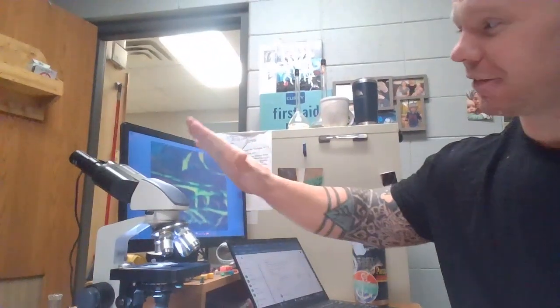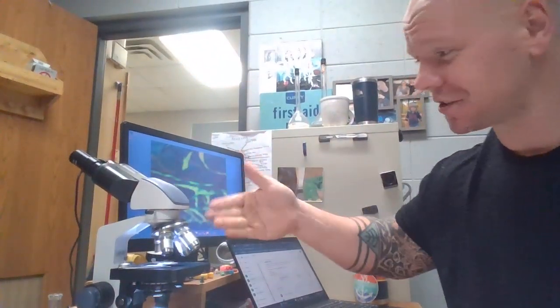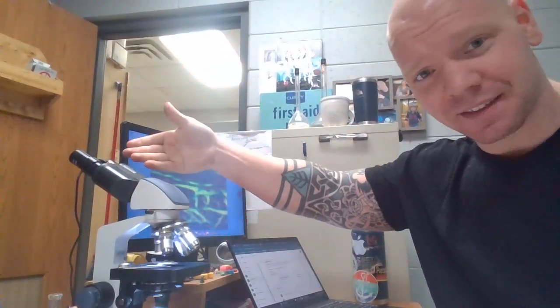All right, so again, just to recap on all the stuff that we did, knowledge on features. All right, we have our head. Attached to our head is going to be our eyepieces at the top, and then we have our objective lenses here. Underneath our objective lenses is our stage. We have our light source, which is going to be able to be controlled by our diaphragm.